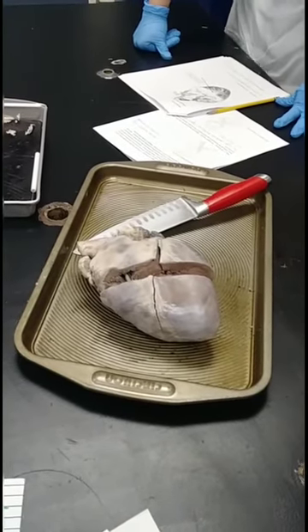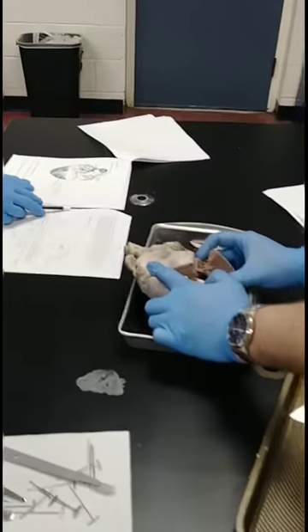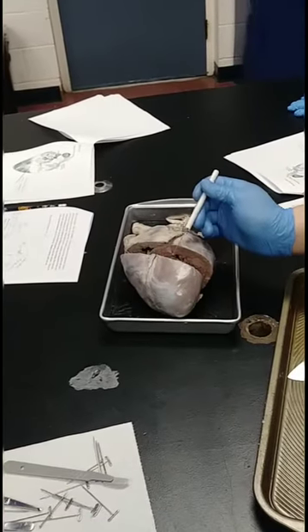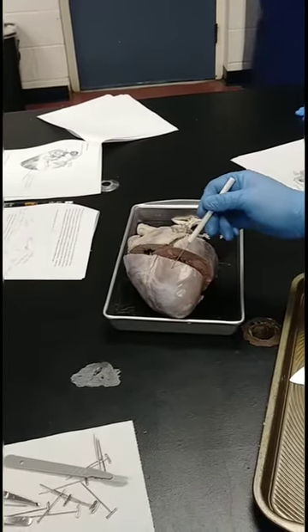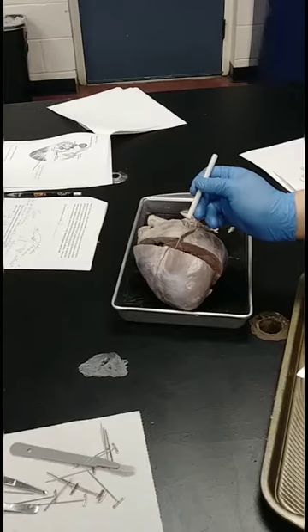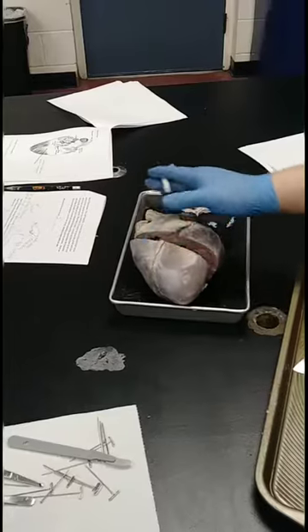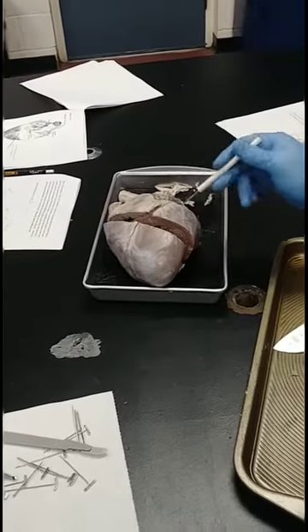Any questions? What you want to do is continue and measure the thickness of the myocardial tissue — the muscle tissue — on the left side of the heart, compared to the thickness of myocardial tissue on the right side. Have you figured out what this thin membrane is? This is the inner part of what's called the pericardial membrane. Normally this whole thing is covered in a big sack called the pericardial sack, which is a sack of fluid surrounding the heart, protecting the heart and lubricating it a little bit. That's been taken off for you, but you still have that inner membrane — that little white layer before you get to the myocardial tissue.